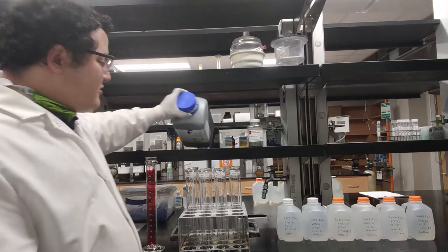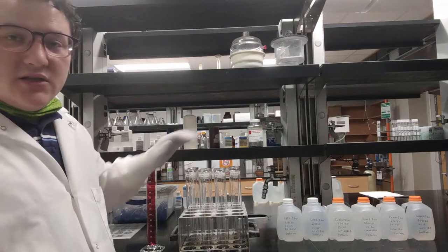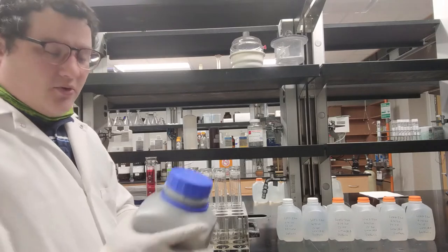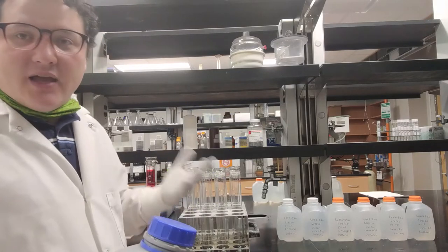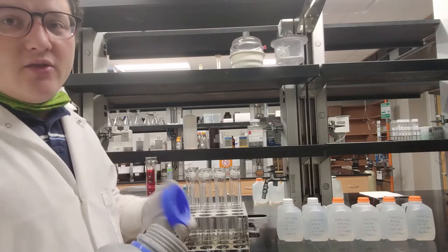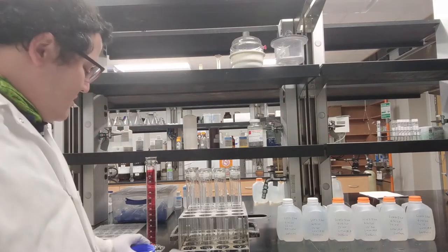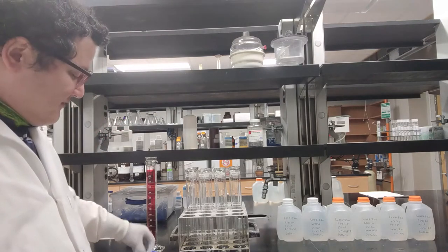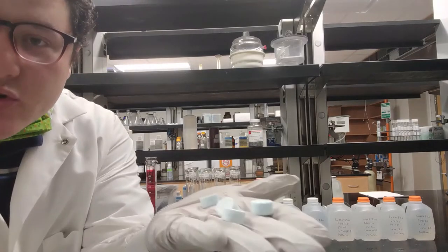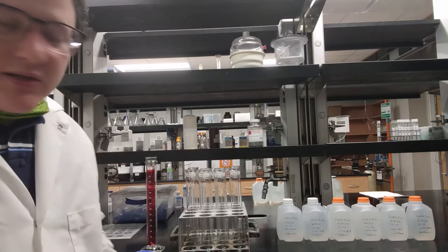The first thing you want to do is prep the reaction vessels. You can measure the water samples in and then put the tablets in, but I find that splashes stuff out. It's easier to do the tablets and the boiling chips first and then add the water on top. Each reaction vessel is going to get four of these tablets. They are measured out so that we don't have to actually weigh them — we just count the tablets and drop them in.